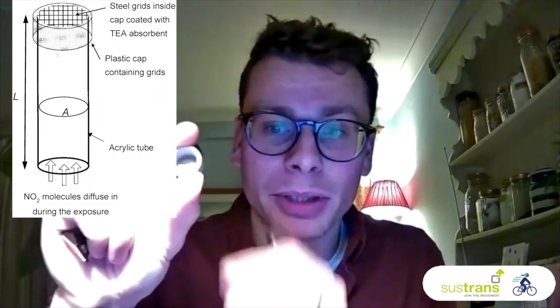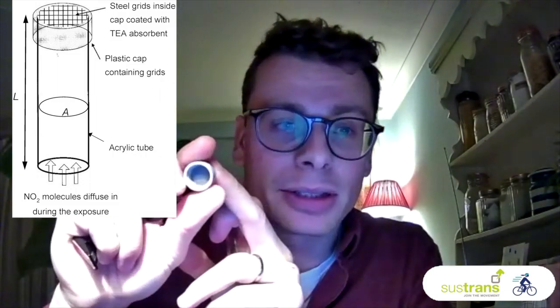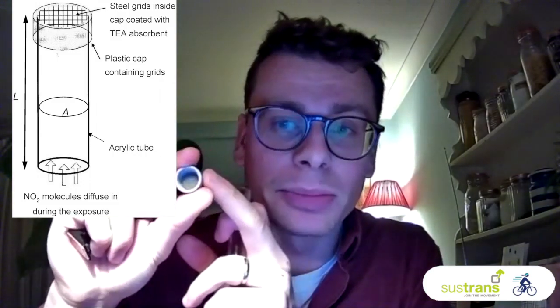Inside there is a stainless steel mesh grid at the closed end of the tube, which is coated with a water-based or acetone-based solution of this absorbent.